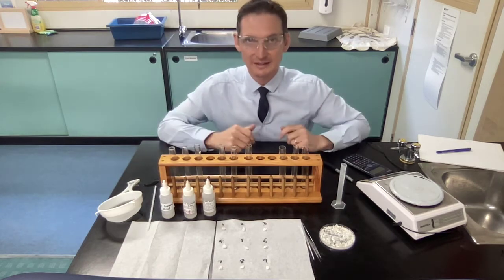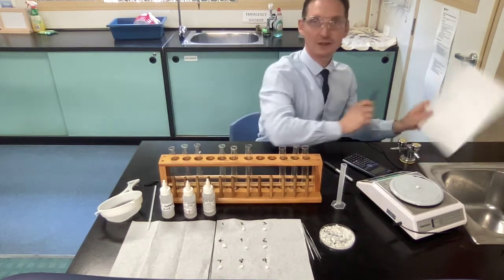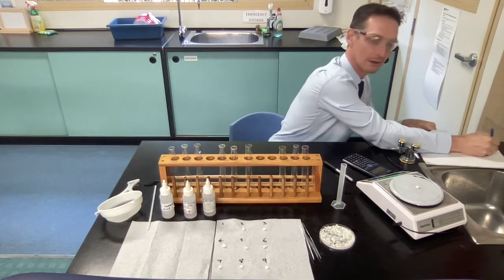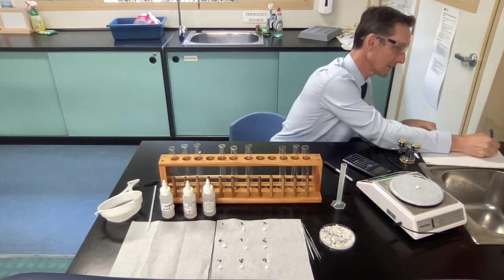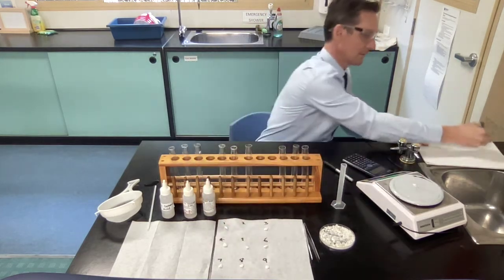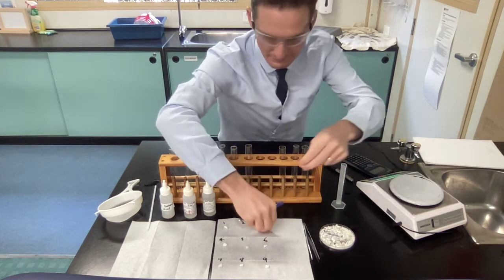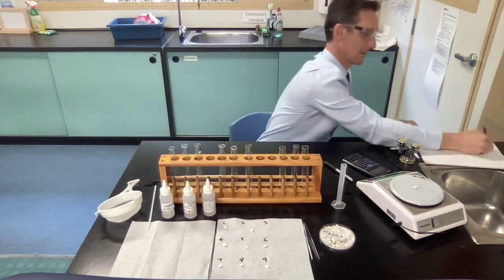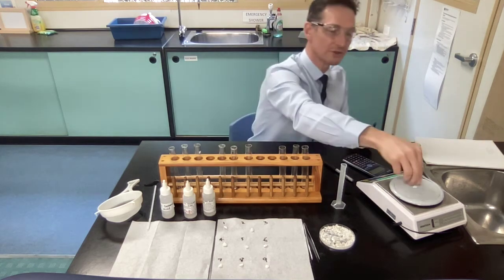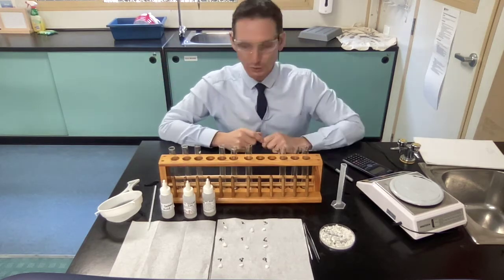I'm only going to simulate this, but you do all of your 9 rocks. So number 1, onto the digital scales. Over here, I'm going to write everything down so I can keep track of it. So I write number 1 is that many grams. Number 2, that many grams. And number 3, that many grams. Now let's assume that you did all 9, which is what you have to do. So I've gone through all 9 and I've written them all down.